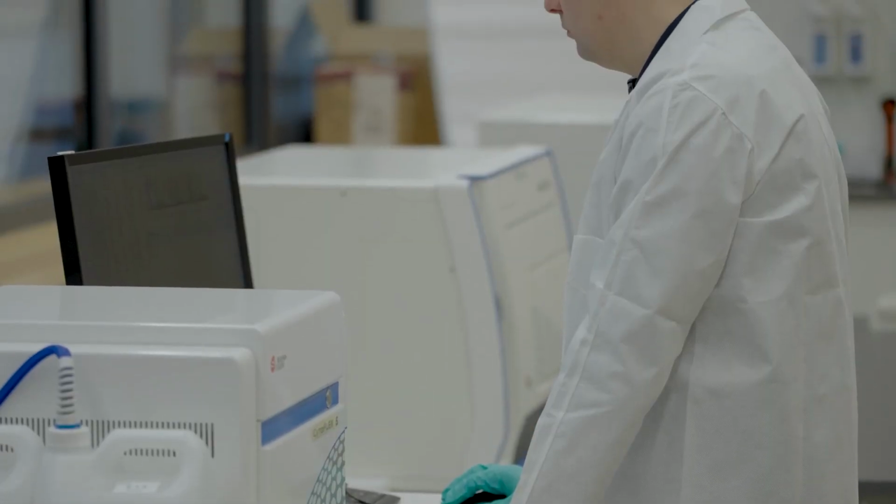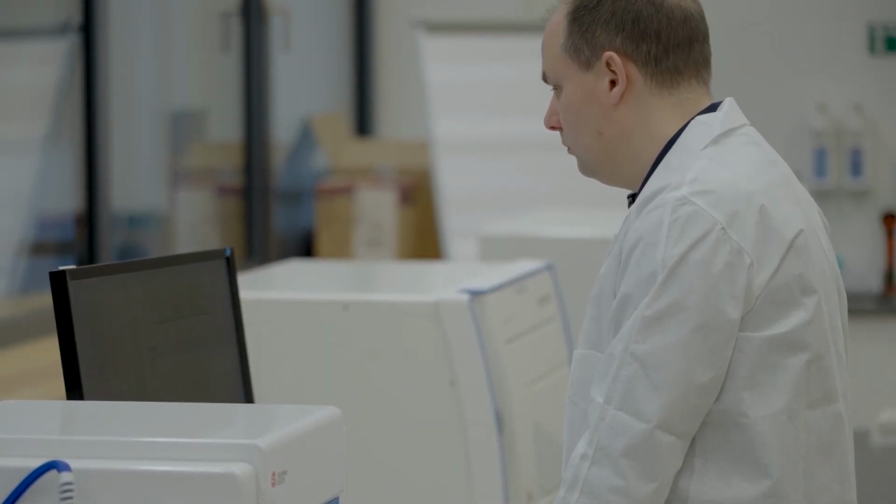I find the possibility to run some panels in spectral and conventional modes quite useful, as I still have some users that prefer conventional cytometry. So now I can actually run their panel in conventional mode, then switch to spectral mode in a few minutes and see which one performs best.